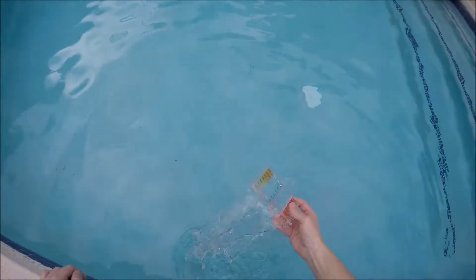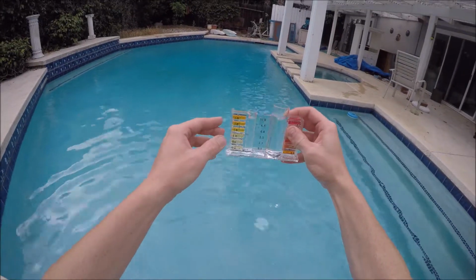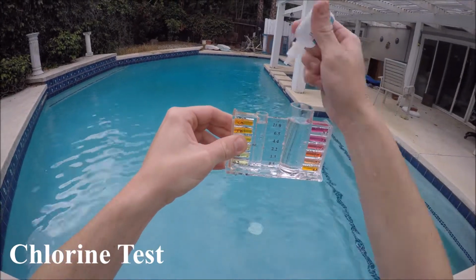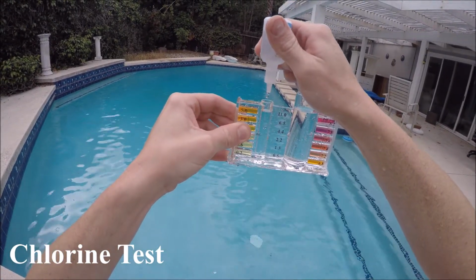After each test, be sure to rinse out the test block completely to make sure that your results are accurate. Next, we'll be testing for chlorine by filling the vial up to the indicated line and adding 5 drops of the number 1 reagent.